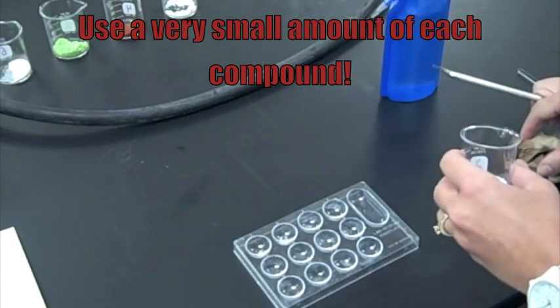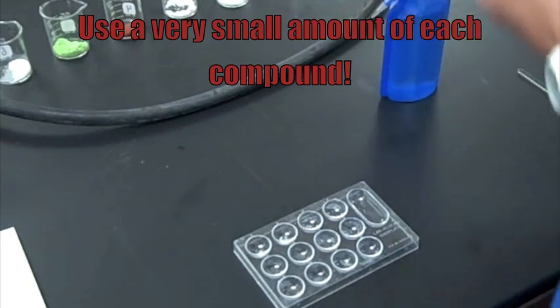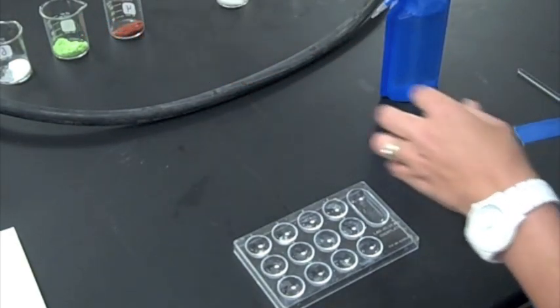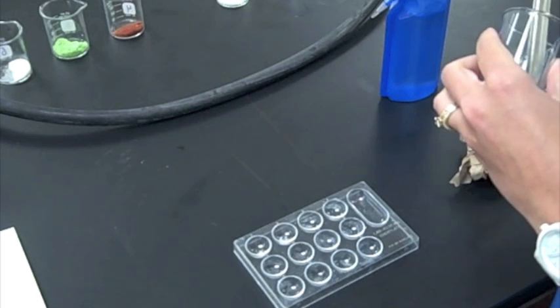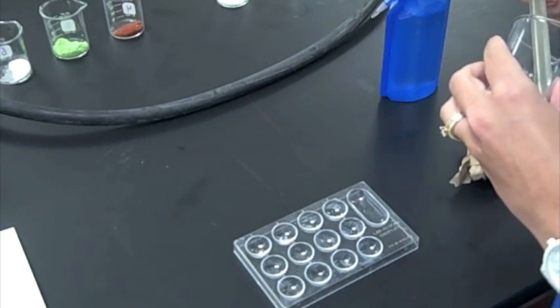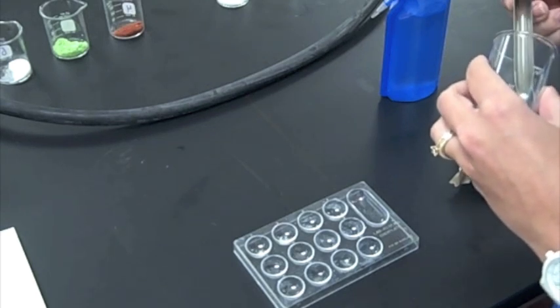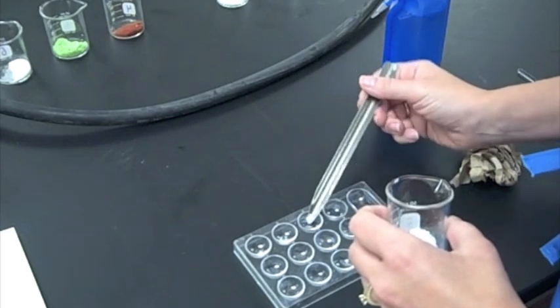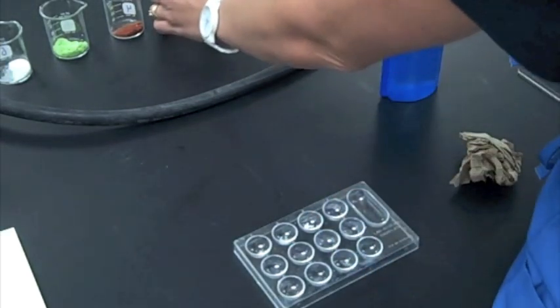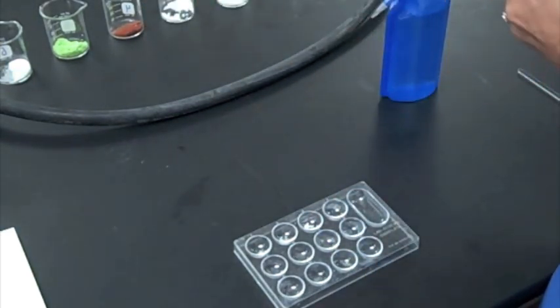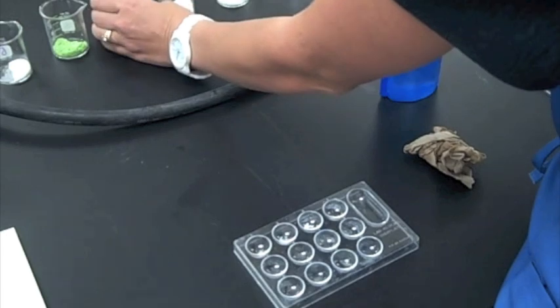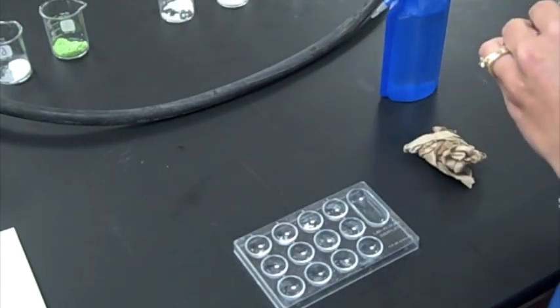Because all that we're going to be looking for is to see whether or not it dissolves in water. Now what we expect is that the ionic compounds are going to dissolve in water and the other guys are not. The covalent compounds, as long as they are nonpolar, which all the ones that we picked are nonpolar, they should not dissolve in water.